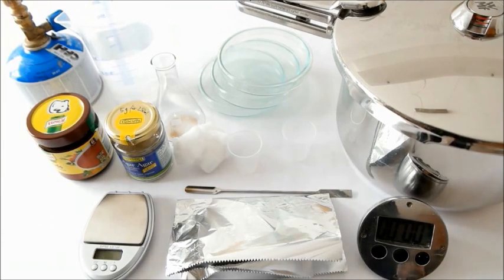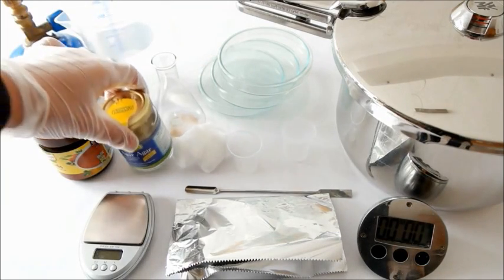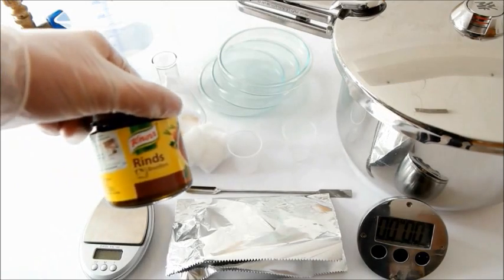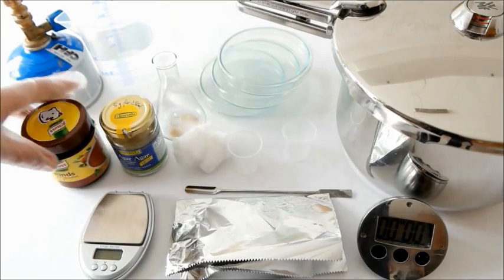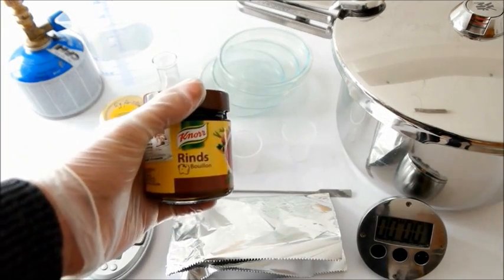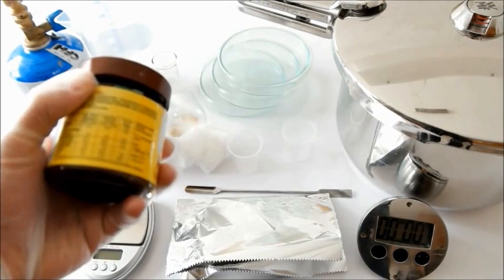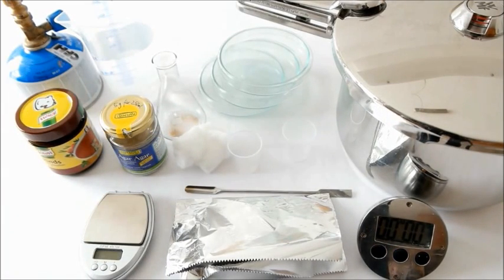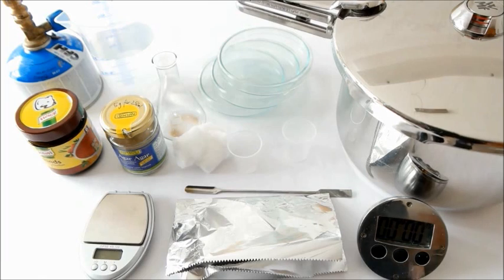You'll need agar agar and beef bouillon from a local supermarket. It's important that the beef bouillon contains peptone which makes the bacteria grow because they eat it.